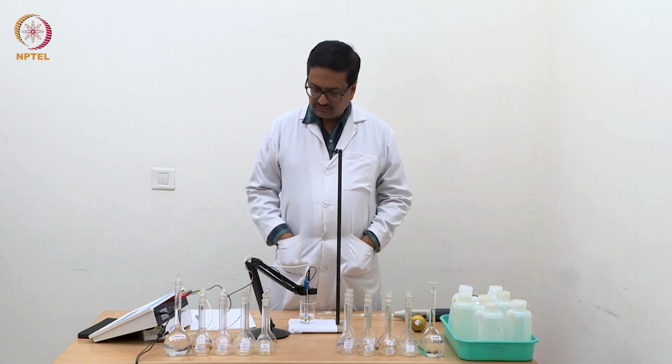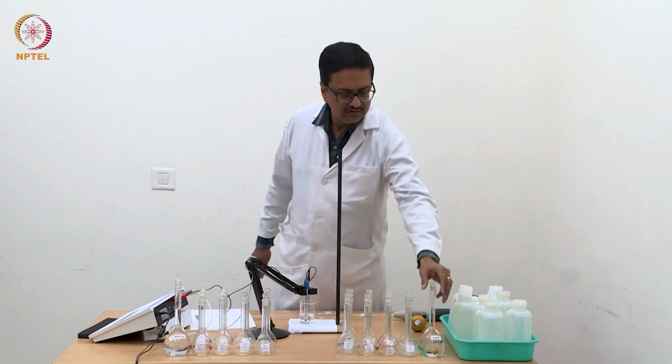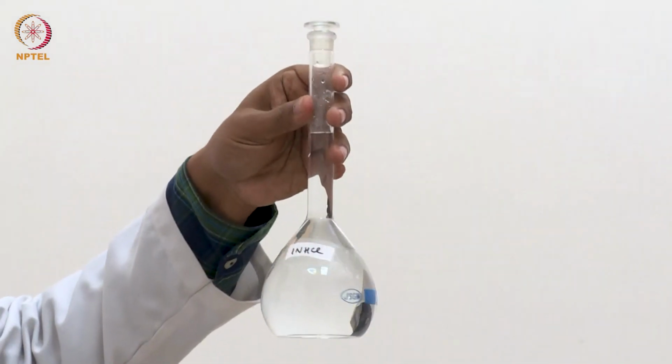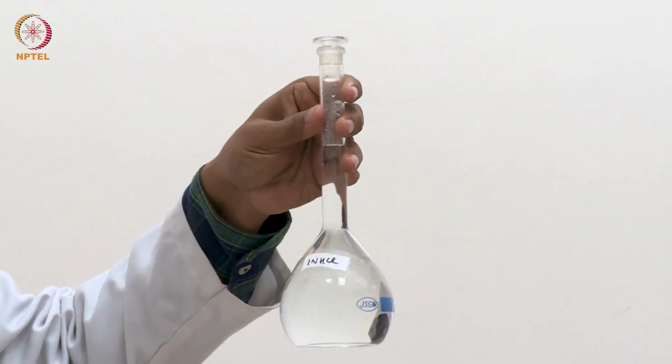For example, we are going to use HCl solution. This is one normal HCl solution, to make various dilute solutions of HCl.